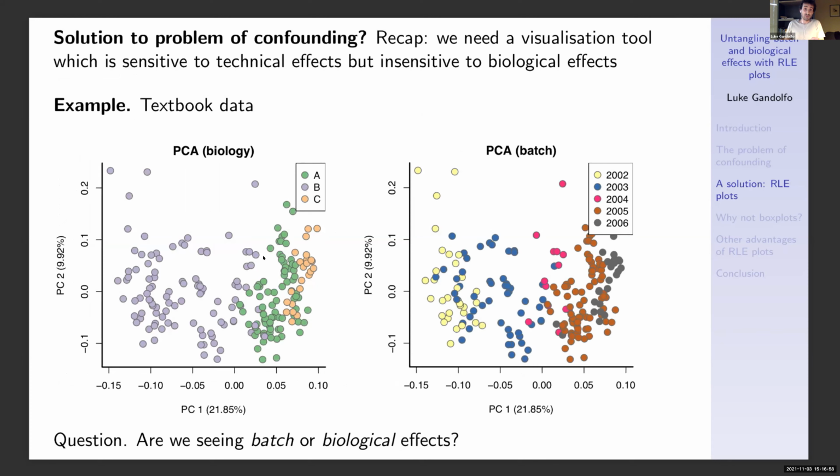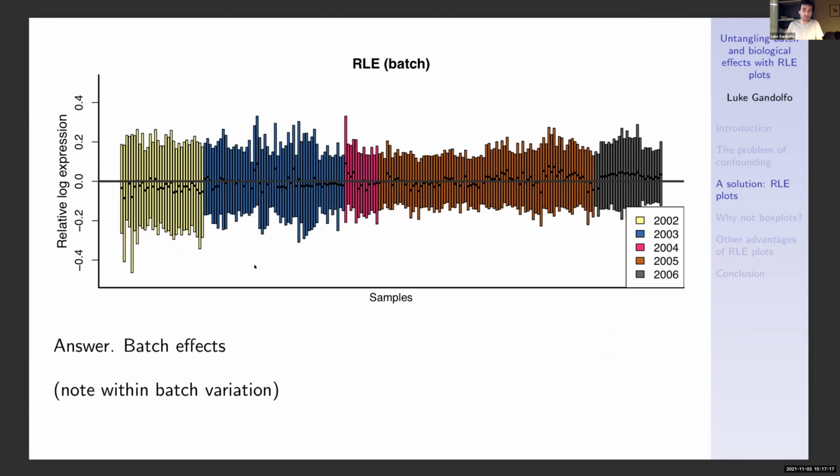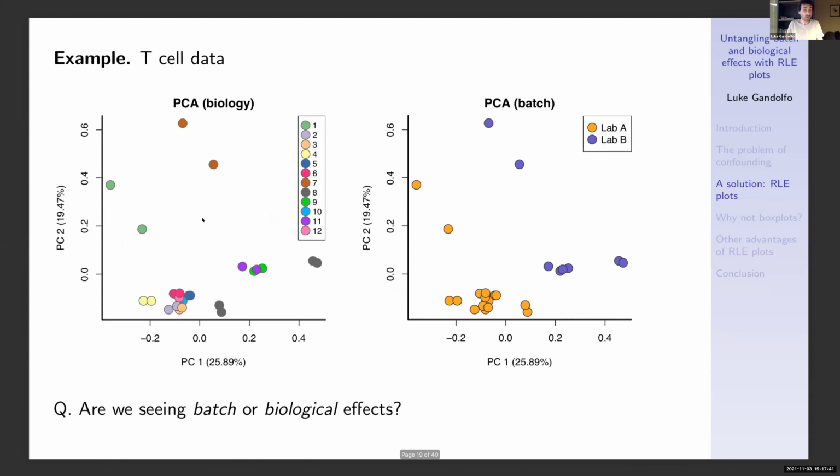And is this a solution to the problem of confounding, where we needed a visualization tool that was sensitive to technical effects, but insensitive to biological effects? Well, in the case of the textbook data, the question was, are we seeing batch or biological effects here? Well, an RLE plot shows that we're not seeing biological effects, we're seeing strong batch effects, because these tend to be below 0, these tend to be above 0, and we also see a large amount of within batch variation too, showing that it's not just a batch variable that's driving technical variation here. What about the T-cell data?